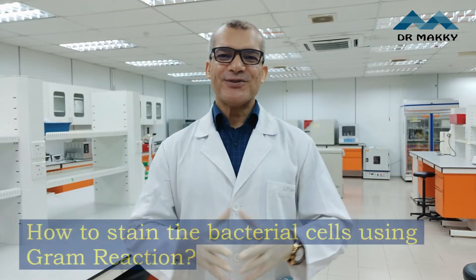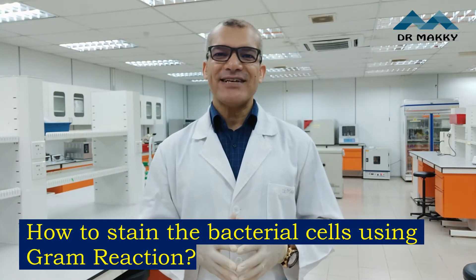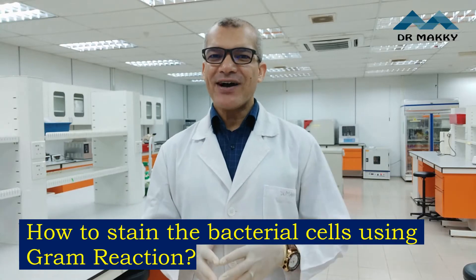So let's go over how to stain the bacteria using Gram stain. Let me show how after the break.